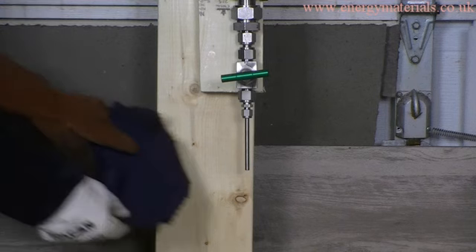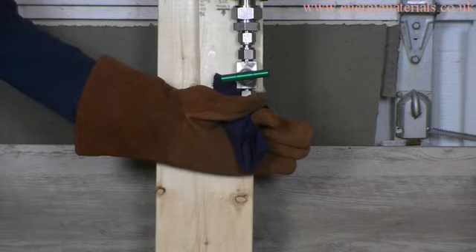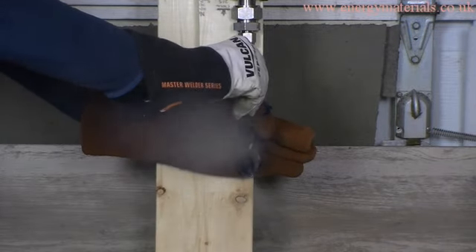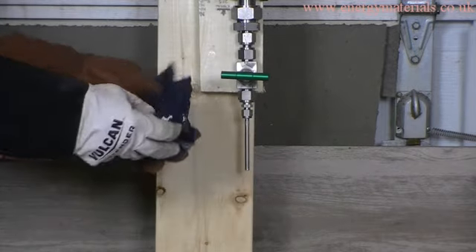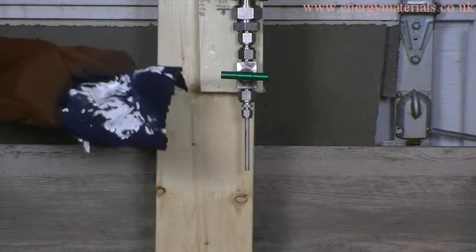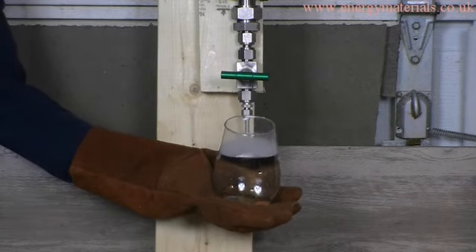If we cause a rapid state change and convert the liquid CO2 into gaseous CO2 with an expansion, we can cause a cooling effect — as demonstrated here, where we are wrapping a cloth around the bottom of the pressure vessel and opening a valve. The rapidly expanding CO2 causes a cooling effect, and we can convert some of our CO2 into dry ice.